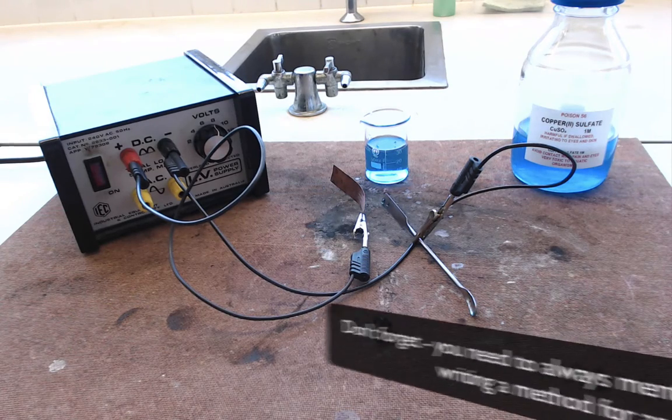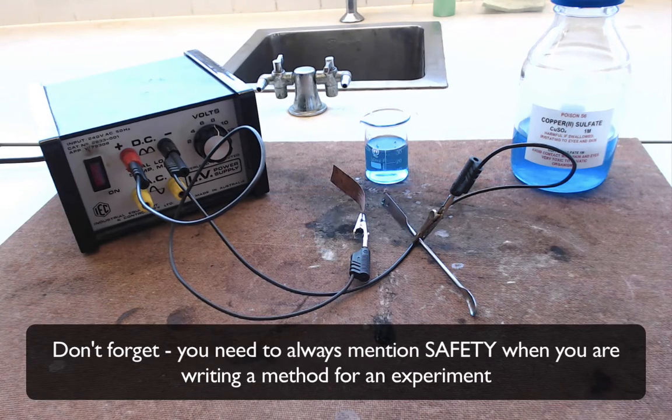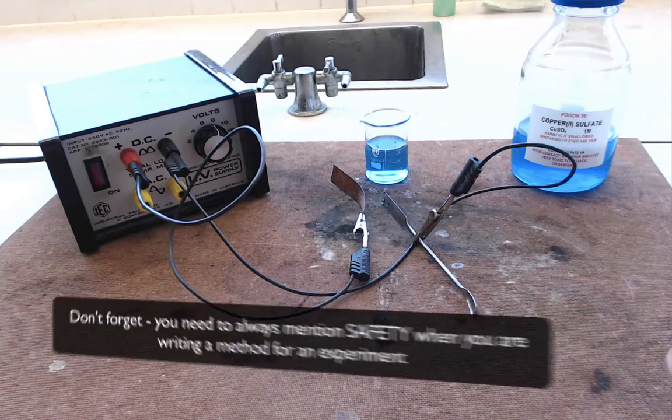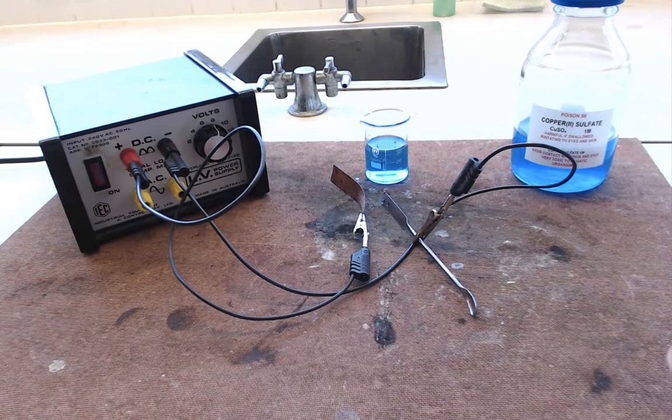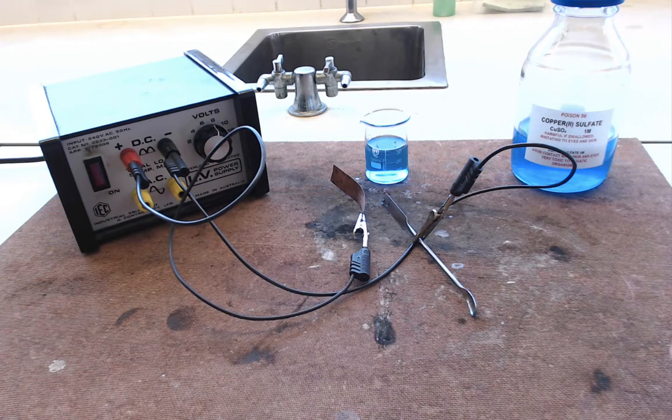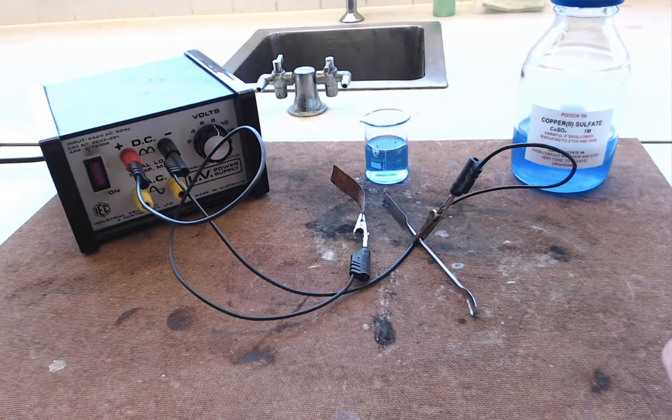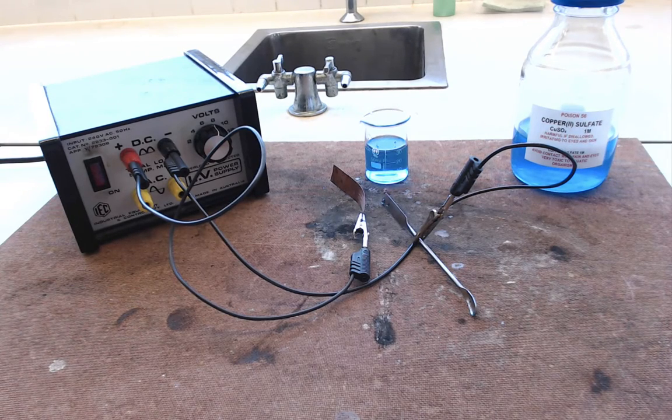Now as far as safety is concerned in this experiment there's really not an awful lot to concern ourselves with. But the most important thing is to make sure that the electrodes don't touch when you don't want them to, because that will just create a short circuit in your circuit and could lead to damage in your power pack. So we're going to try and avoid any short circuits.